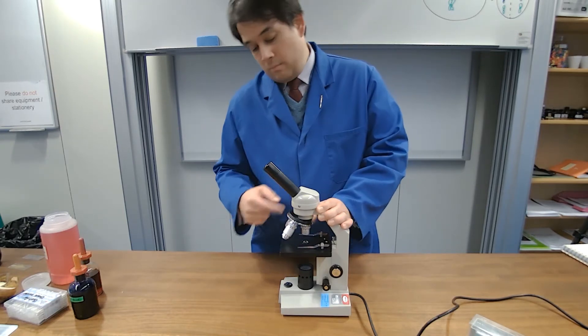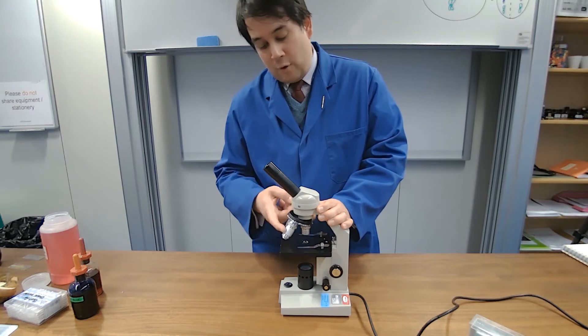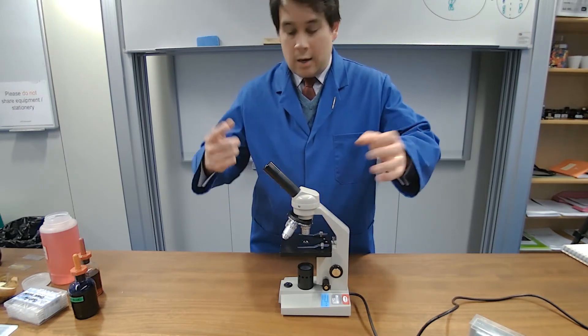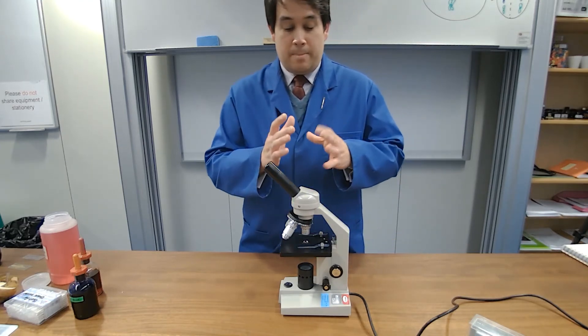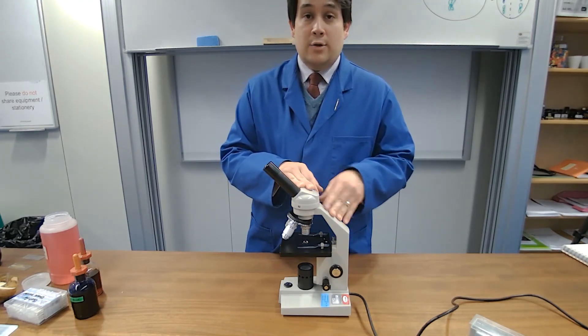Also it then goes up to 10 and 40. So 10 times 10, 100, 40 times 10, 400 times magnified. And that's the maximum that this particular microscope can go to.